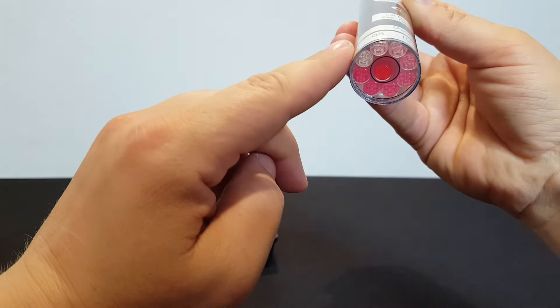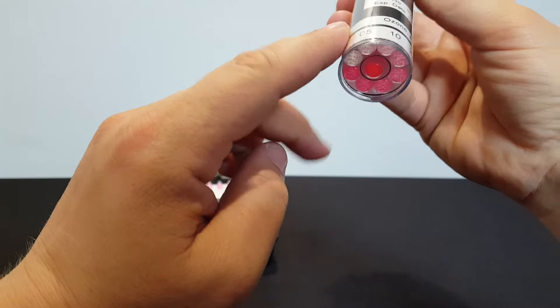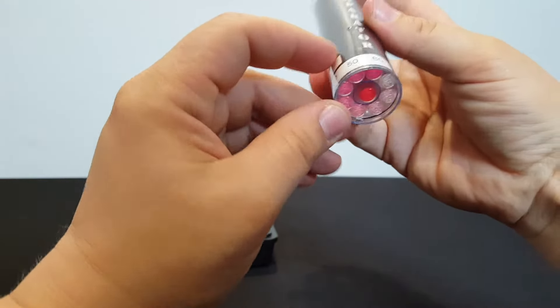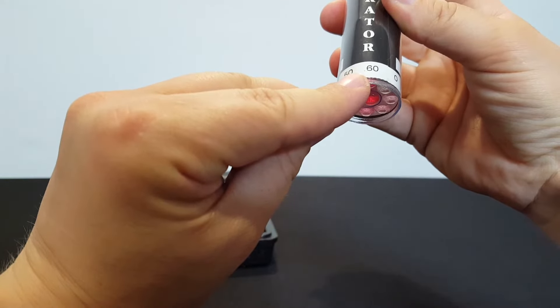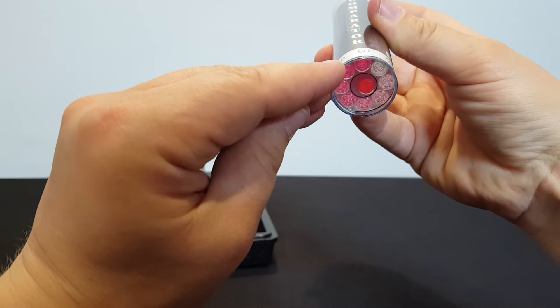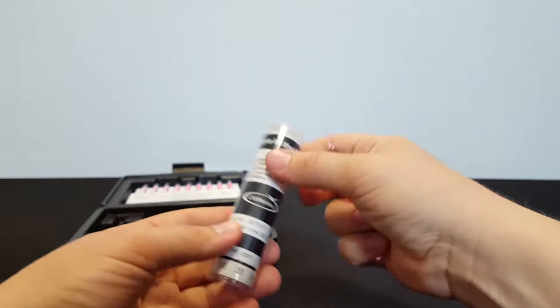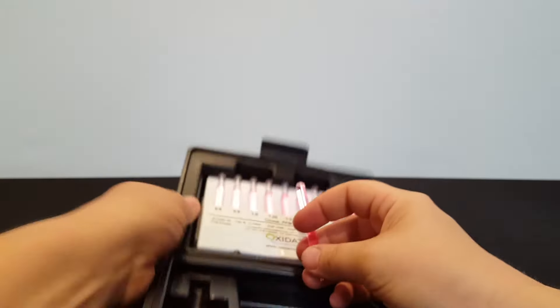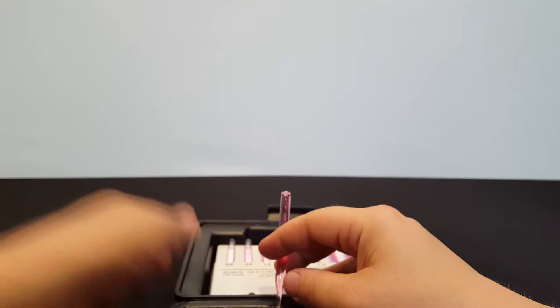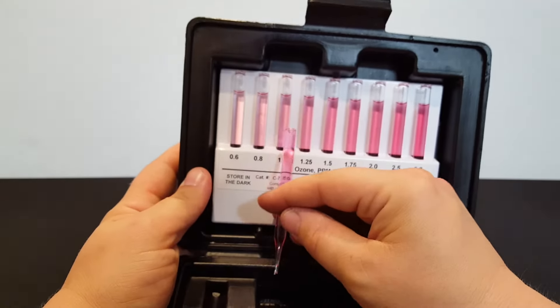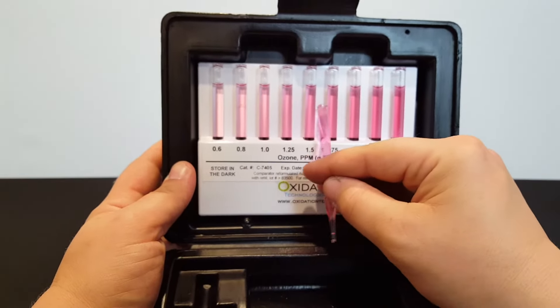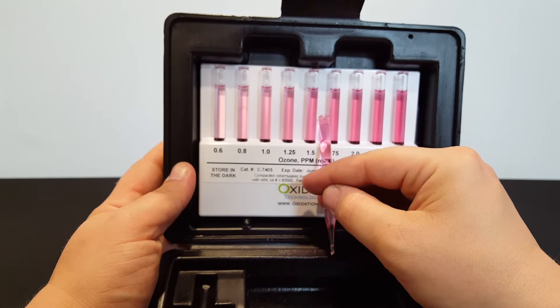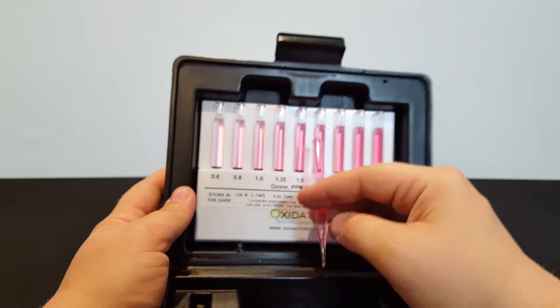So we're going to look closely at the higher level of 0.6 parts per million. When you look closely, I would say that's still darker than that. So I'm going to take it out of the lower level comparator, and then move on to the higher level comparator, which picks up where the other one leaves off at 0.6 parts per million and goes up to three parts per million. In this case, I feel like the pink about matches the 1.5 parts per million dissolved ozone spot.